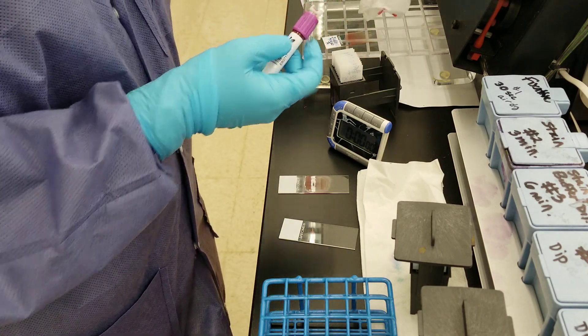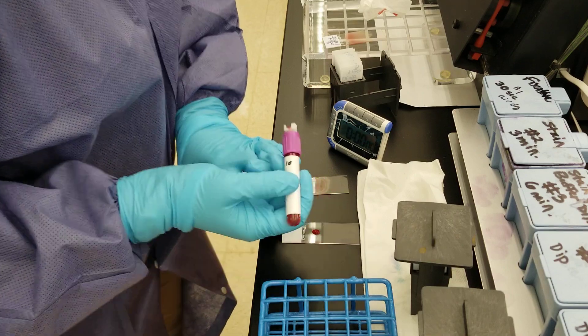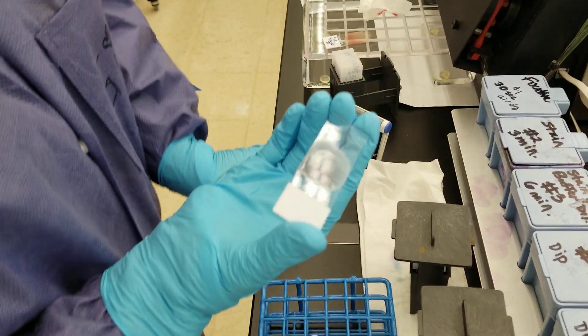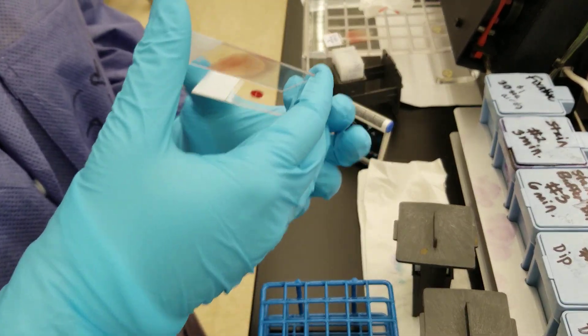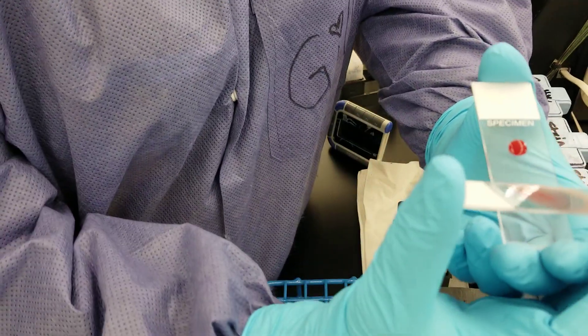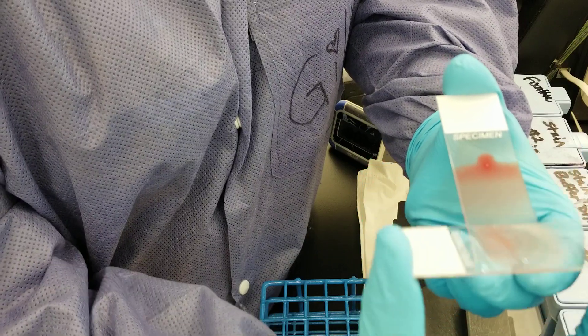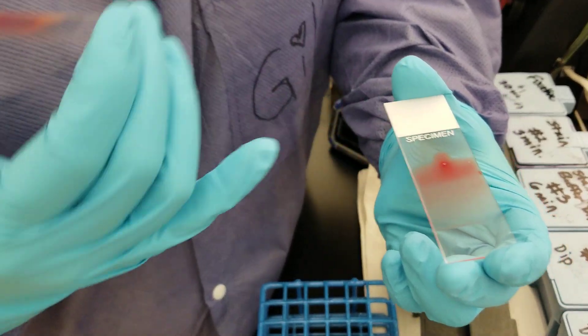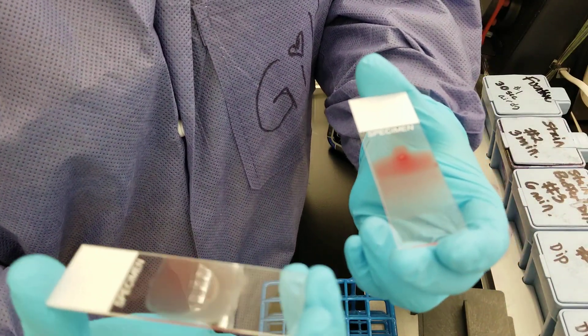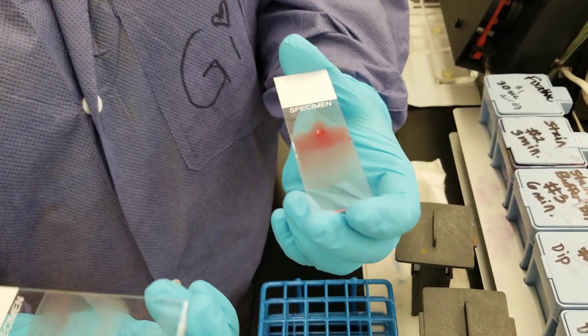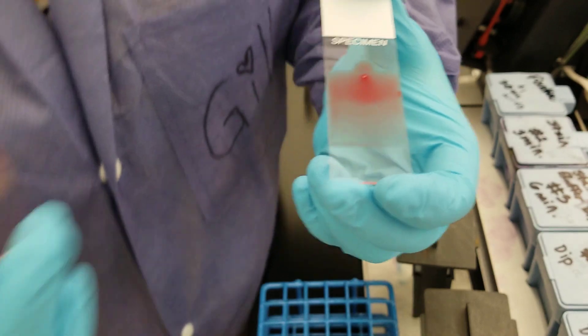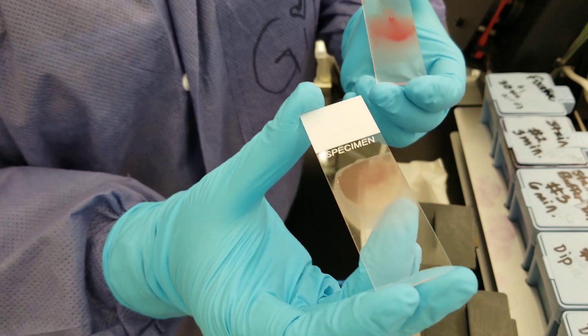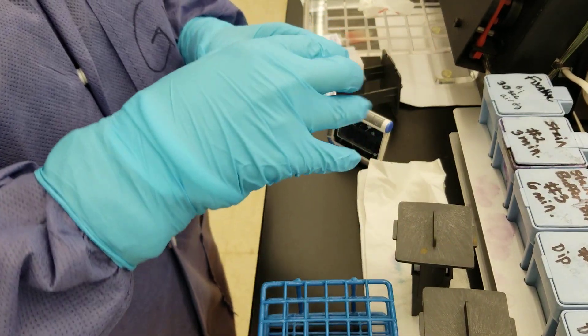Here we go one more time. That's a really big drop of blood, and I'm not really going to use these slides. You can see it right there. I'm letting the blood go across the slide to the edge. You shouldn't go all the way to the edge, but it was a really big drop of blood. I was trying to get it into view, so hopefully you just got two angles. Obviously this is not a good slide. This was a good slide that I could use, so I'm really just going to throw these away.